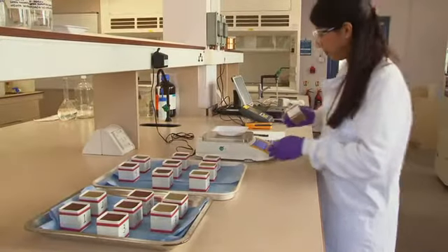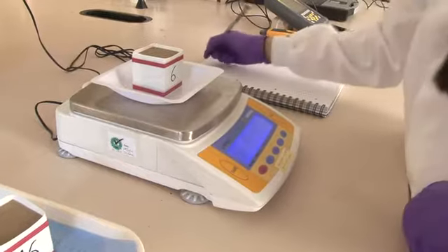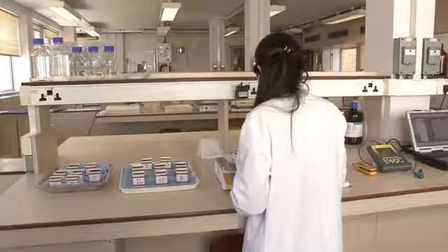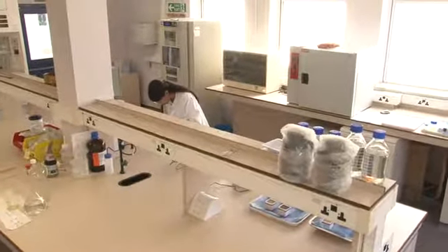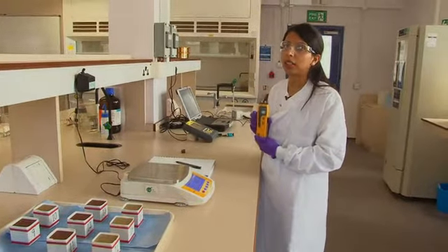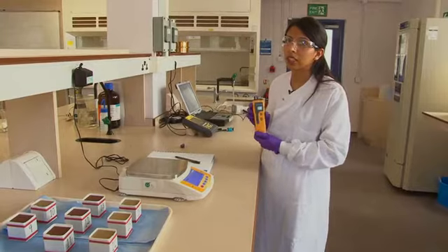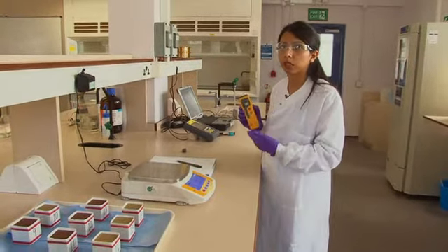First of all, we have to measure the stone as a reference. So we measure hardness, the level of moisture in the stone, the colour of the surface and its weight prior to inoculation with the test algal species. The way we measure the moisture content of the stone is using a device called a protimeter. This measures resistivity as a proxy for the amount of moisture in the stone.